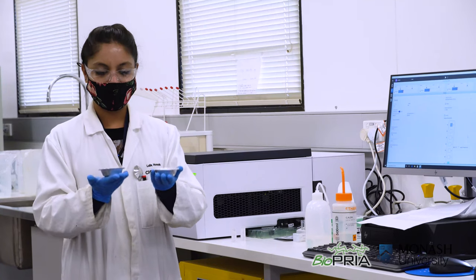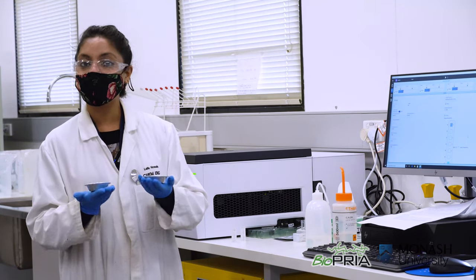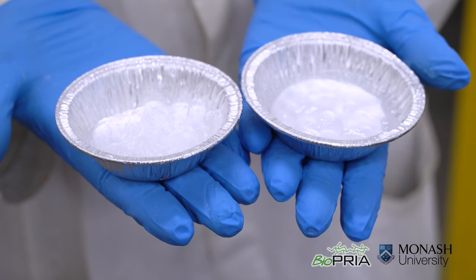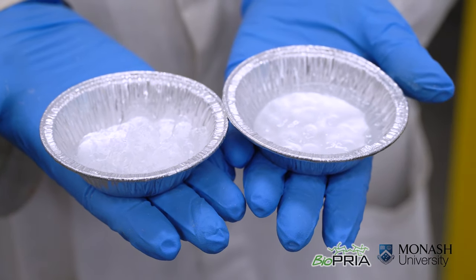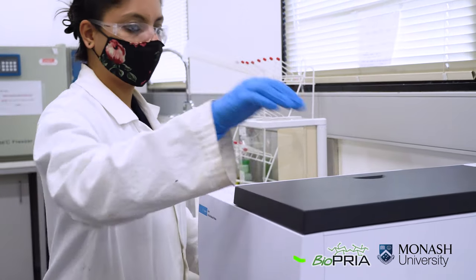Here you can see our beautiful TEMPO oxidized homogenized nanocellulose hydrogel. As you can see they are optically transparent. Now we are going to compare the degree of fibrillation using UV-Vis.